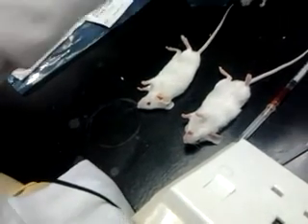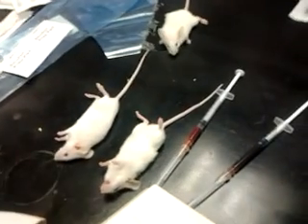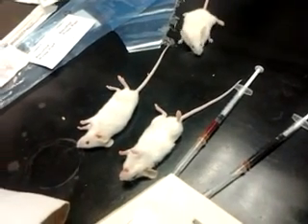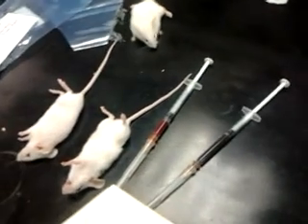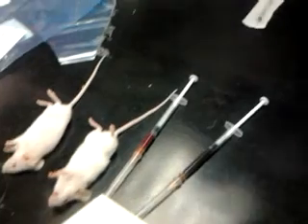He's asking a question. Mr. Mike, he's asking how exactly the needle pops into the heart, how do you estimate it? Yeah. And Loshni, you ask your question here? You must ask me a question, and I'll answer.